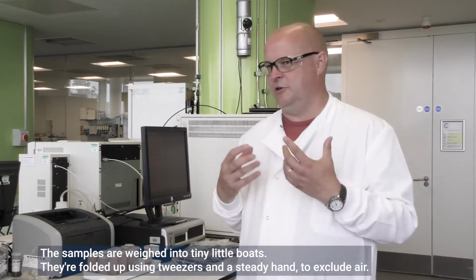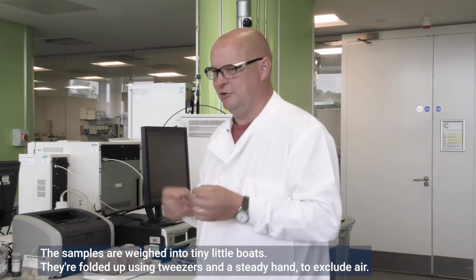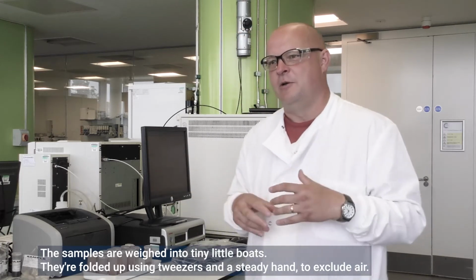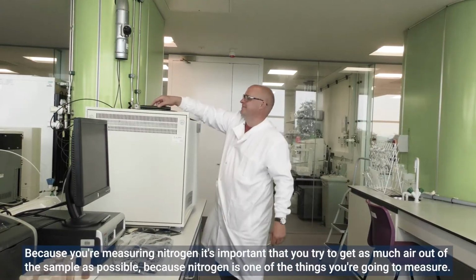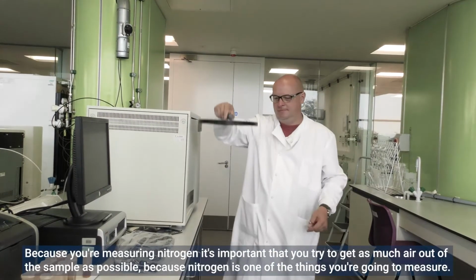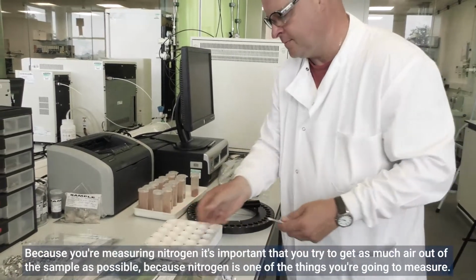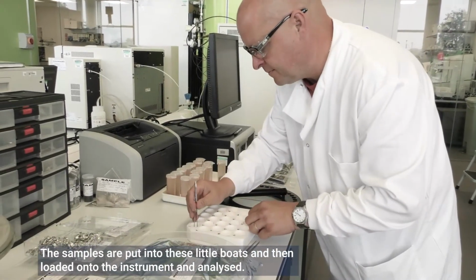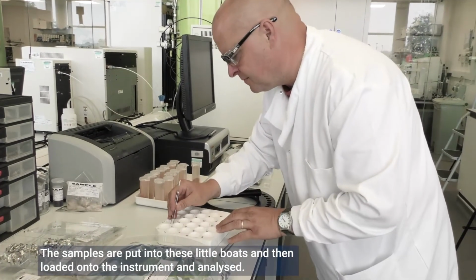So the samples are actually weighed into tiny little boats. They're folded up using tweezers and a steady hand to exclude air. Because you're measuring nitrogen, it's important that you try to get as much air out of the sample as possible, because nitrogen is one of the things you're going to measure. So the samples are put into these little boats and are then loaded onto the instrument and analysed.